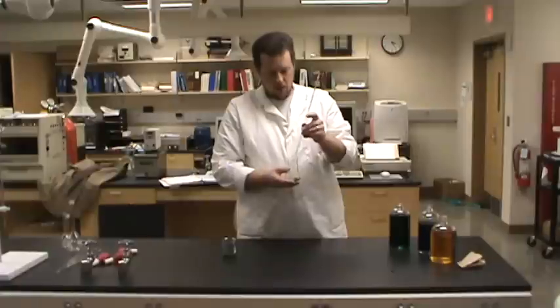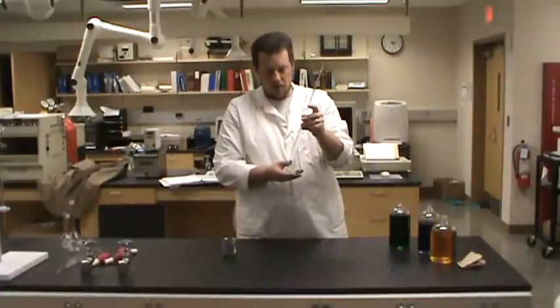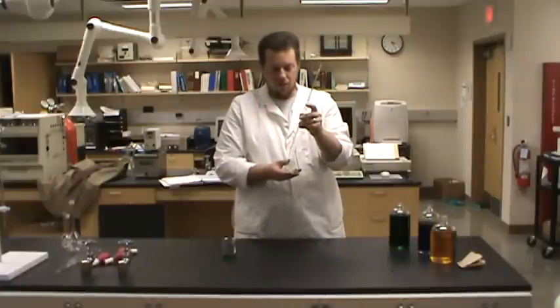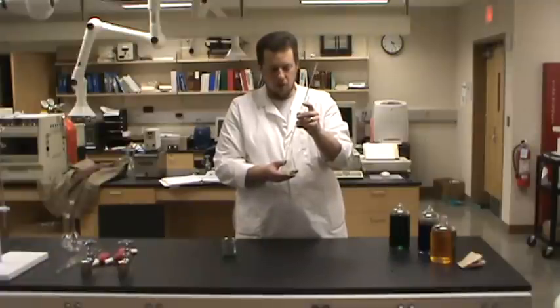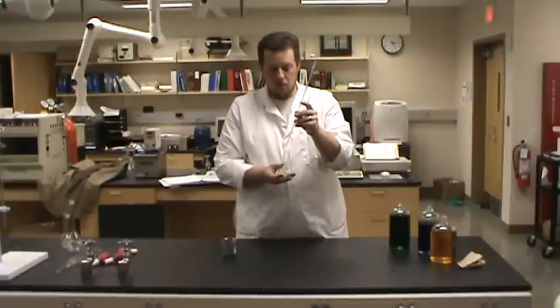So you see we're getting to the bottom. It's coming out slowly. You can touch this to the inside of what you're delivering it into. And now here's the important part.